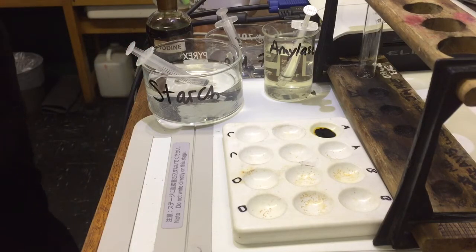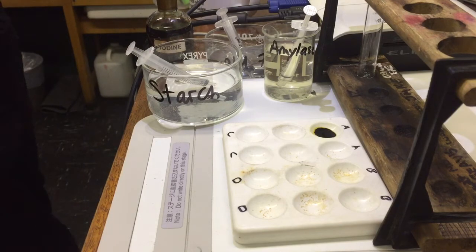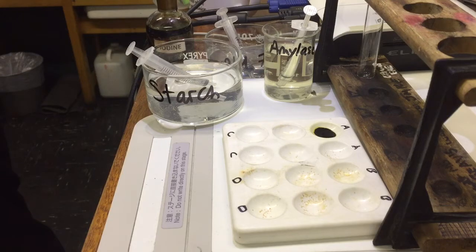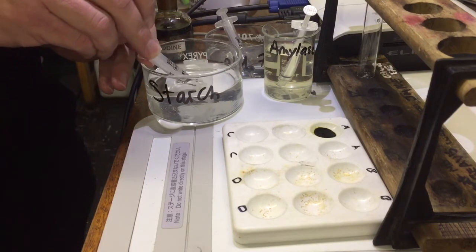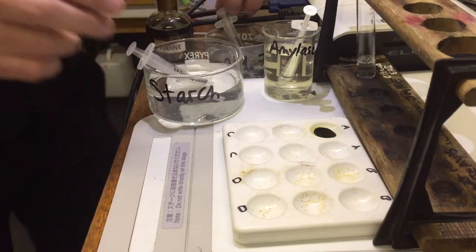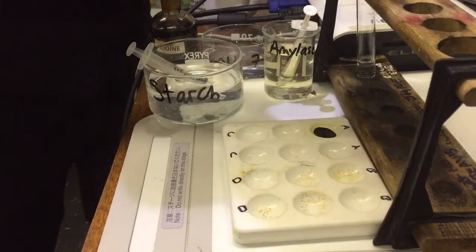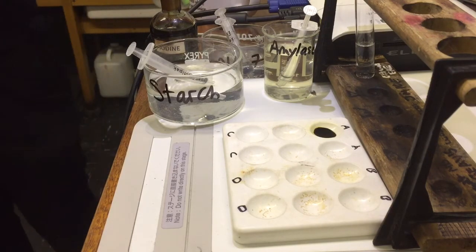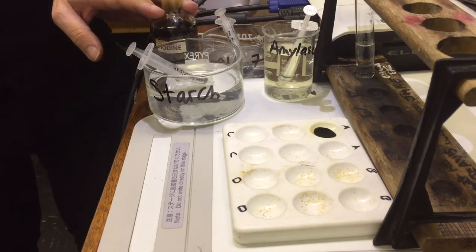When you set this experiment up, it's really important that you have separate syringes and keep them separate at all times. The amylase uses the small syringes; the pH buffer and the starch use the large syringes. Don't mix them. To create our reaction, we're going to take two millilitres of starch and two millilitres of the pH buffer we have chosen. We're not going to add the amylase yet — it's really important we don't add the amylase yet, because when we add the amylase the reaction will start.